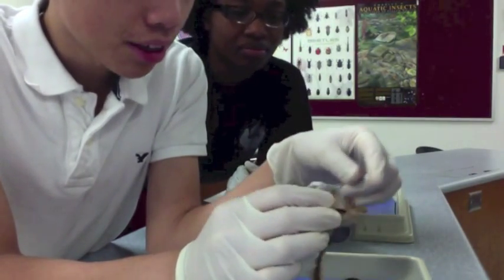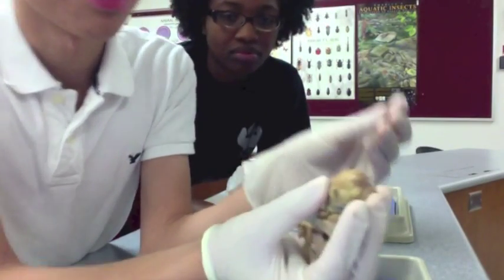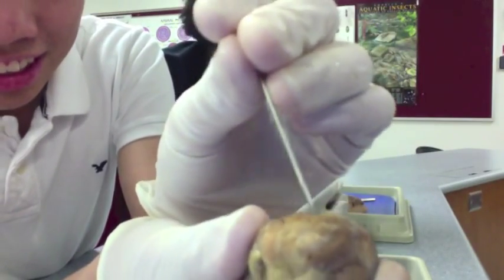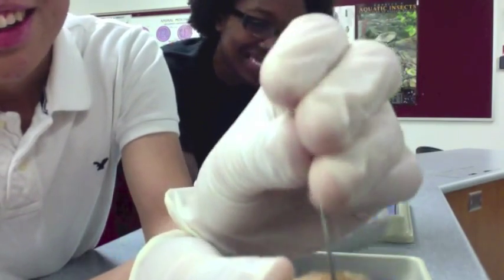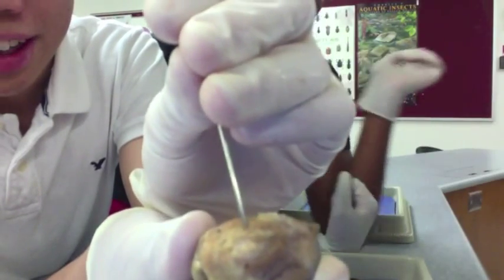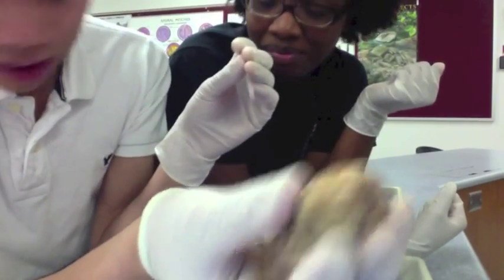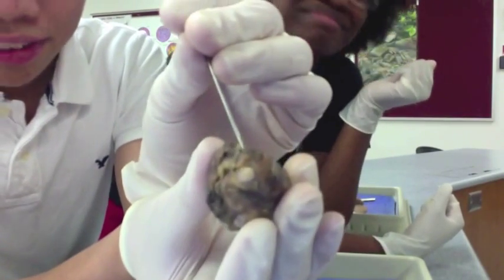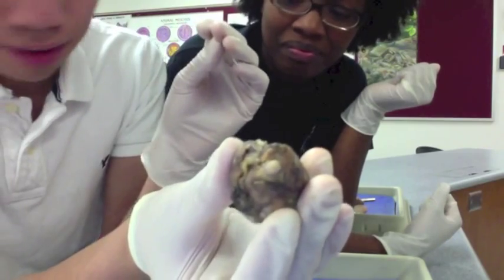You have your optic nerve — this little hard dot thing that you can see right here. See that little light area right there? That is your optic nerve.